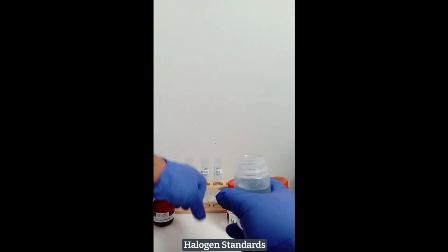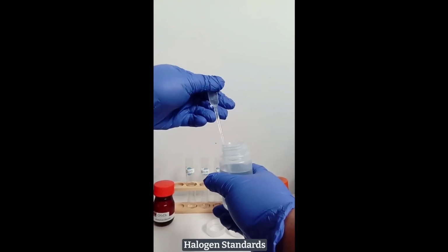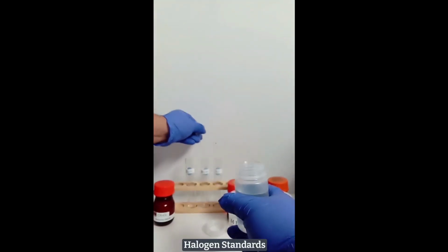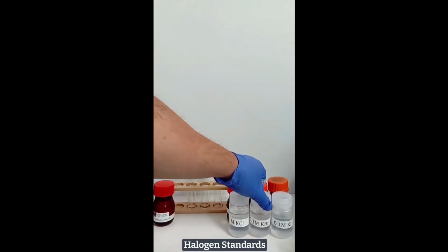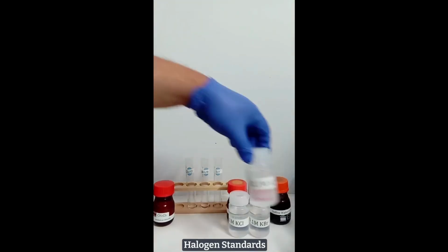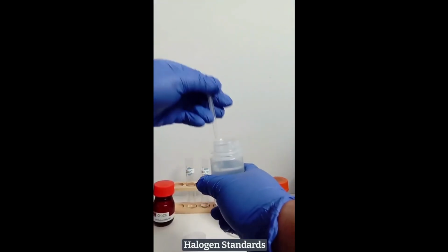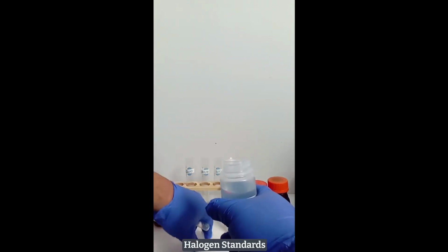The second test tube gets a similar volume of 0.1 molar potassium bromide solution. The third test tube gets a similar volume of 0.1 molar potassium iodide solution.